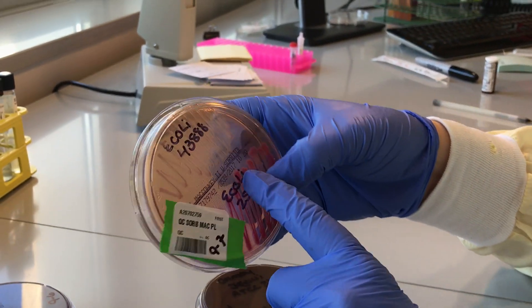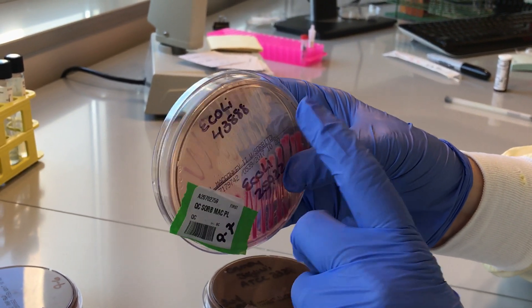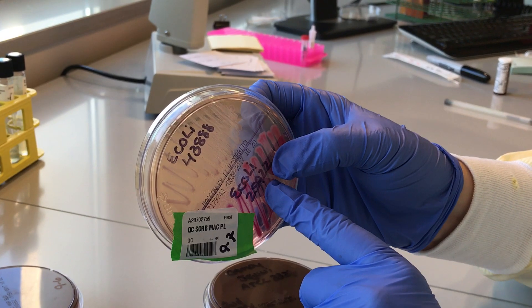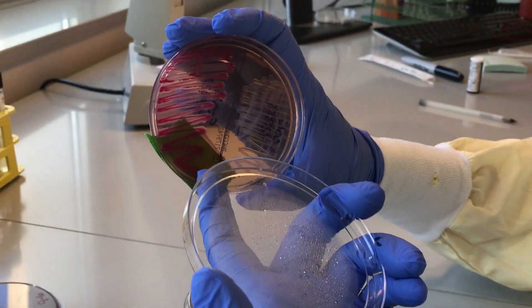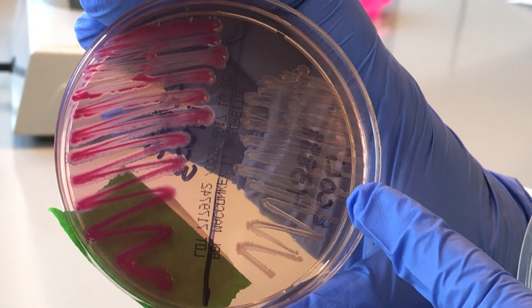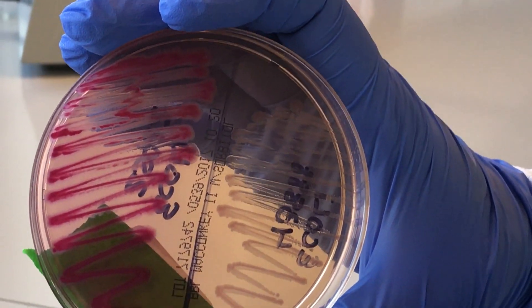This next one is MacConkey with Sorbitol. The enterohemorrhagic E. coli — the EHEC, as opposed to ETEC for travelers — this is for enterohemorrhagic, which we have to test for. The EHEC type of E. coli, which is O157:H7, does not ferment sorbitol. This is your regular basic E. coli, and this is the O157, the kind that causes hemorrhagic colitis. Anytime you see anything clear on a MacConkey agar, any type of MacConkey agar, it's bad news — I mean, you should check it.